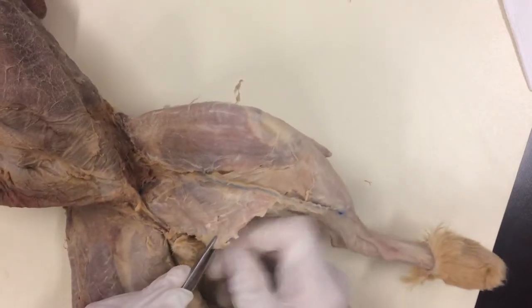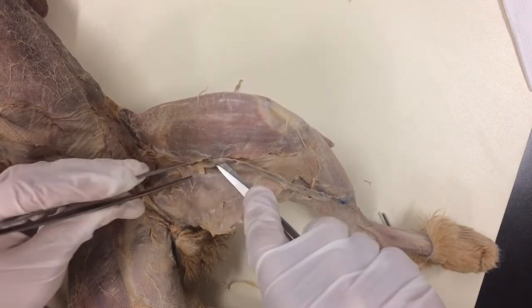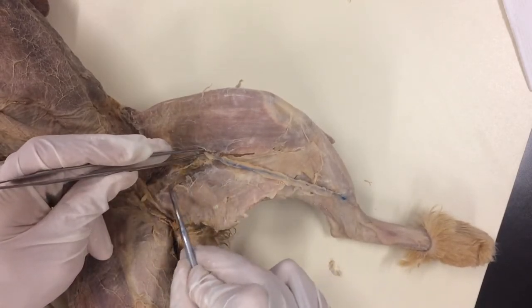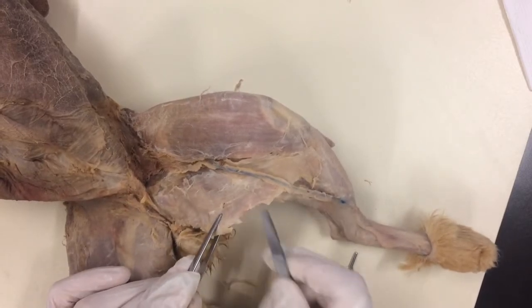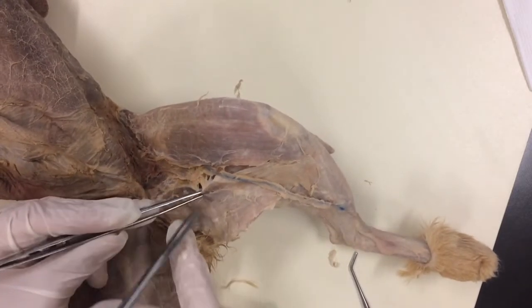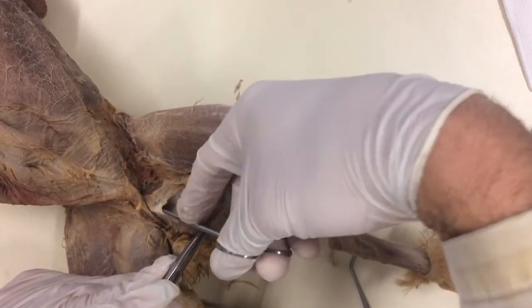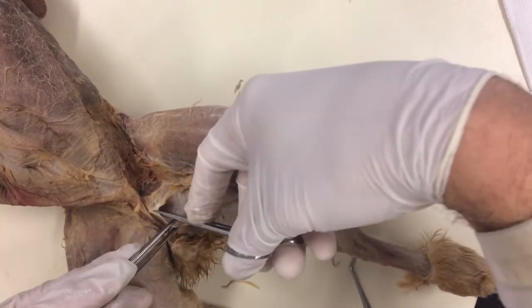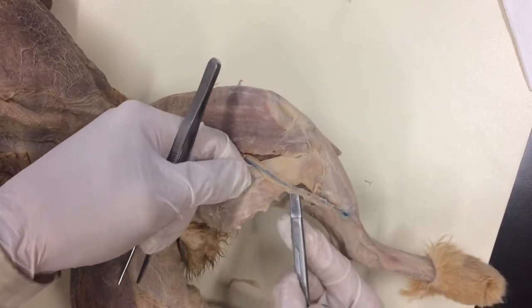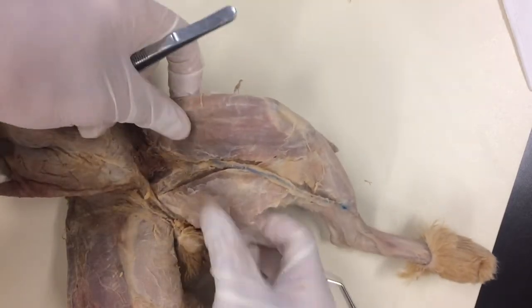Scissors are closed — what I'm going to do is just work my way up here, and you can see I'll come right out on the other side. A little bit of connective tissue here, and when I clear that you can see the edge — this is Gracilis. You can see the edge of the muscle right there. If I worm my scissors, just wiggling back and forth like this, I'll come right out onto the margin. And there it is. I'm just going to come back and clean that up, working it away. And there you have it.